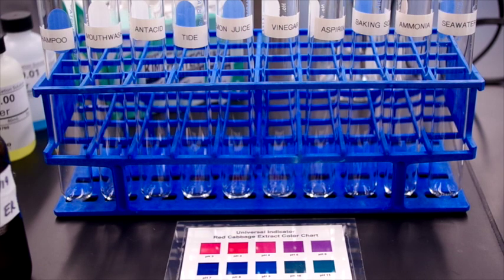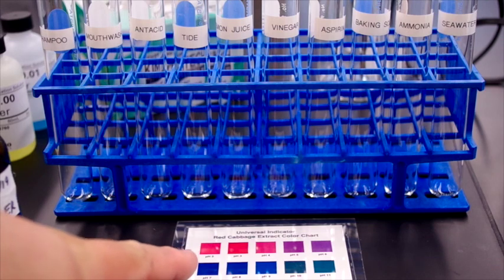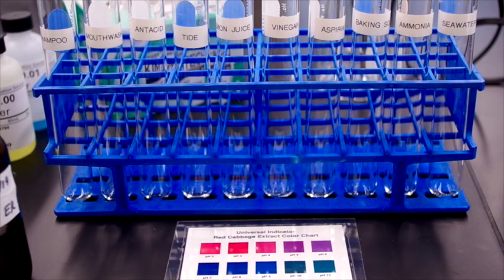Part A of the procedure tells you how to prepare the red cabbage indicator and to standardize it. However, we will be skipping that part because we have a useful universal indicator color guide, which will be included as a freestanding photograph along with this lab video for you to consult when making predictions about the pH of your solutions.